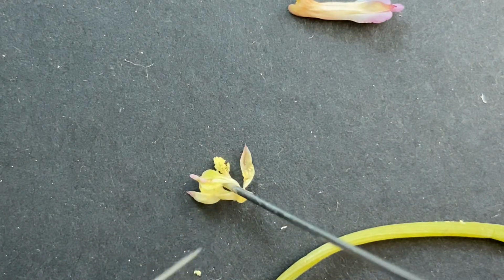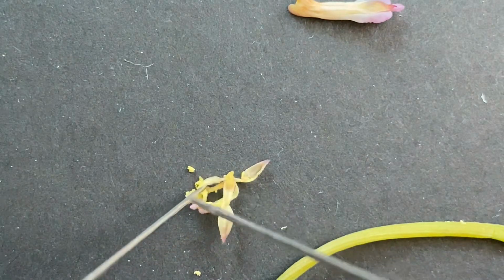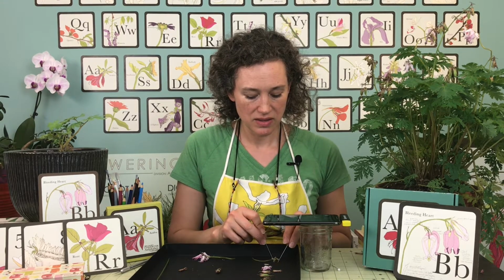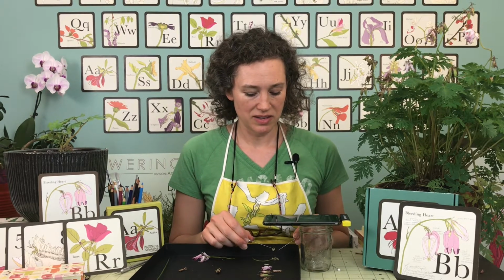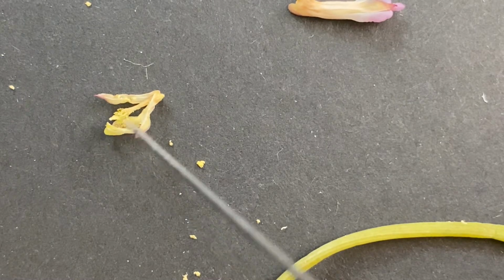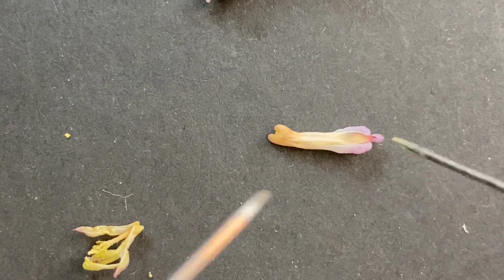Okay, the bleeding hearts are really difficult because they're enclosed. So you kind of have to cut them open in order to get to the inside. But as you do that, the stamen like to come out because the stamen are actually attached at the base to the sepals. So it's a little tricky. All right, got it open. So there it is in all its glory, falling apart. You can kind of see right there in the center, we have the pistil and the stamen around it. It'll be a little easier as we get to bigger flowers.